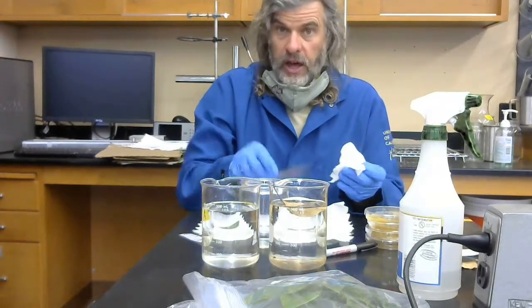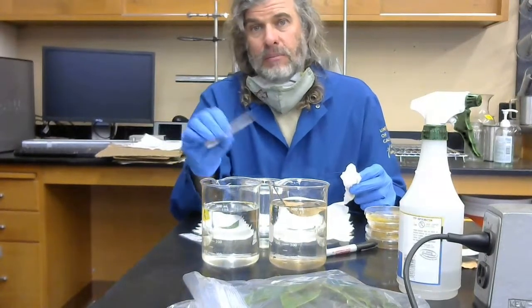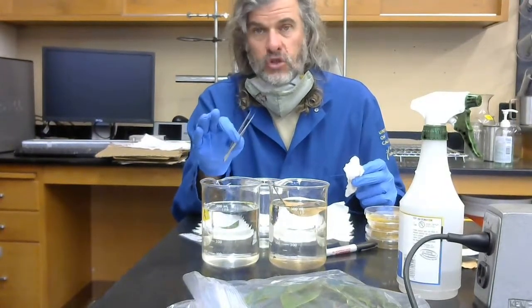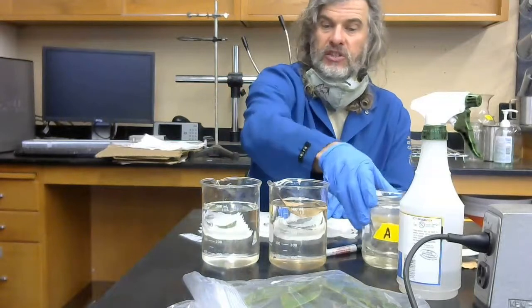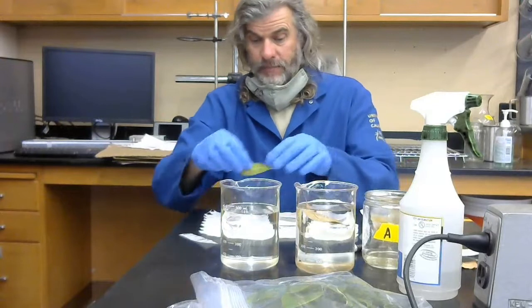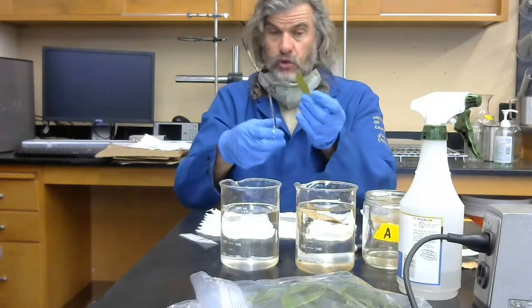You need to sterilize your tools between every sample, and in particular, when you're switching from the canopy to the forest floor. Basically, sanitize your tools whenever you switch among trees or between strata. Okay? So what I'm aiming to do here is get about hole punch size samples from my set of leaves. And again, you've got to imagine me having 5 leaves for this individual tree.